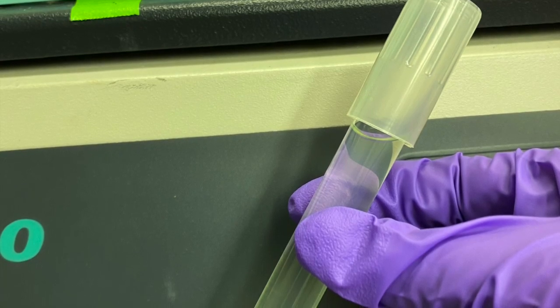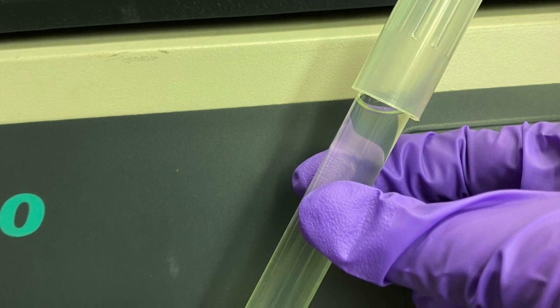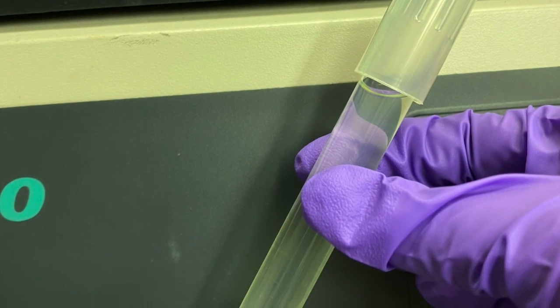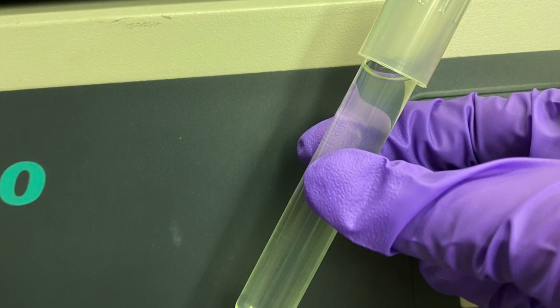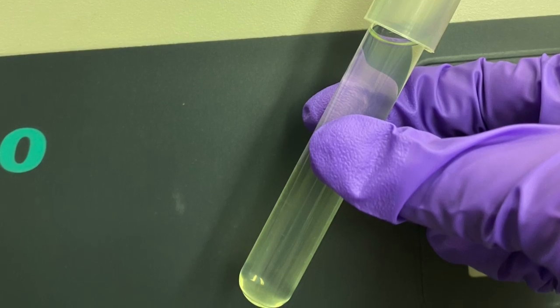After the 8 hours incubation period, your liquid culture should appear cloudy with growth. Pseudomonas bacteria has a very distinct odor. The distinct smell of Pseudomonas can be used to verify that the correct organism has grown in your culture.